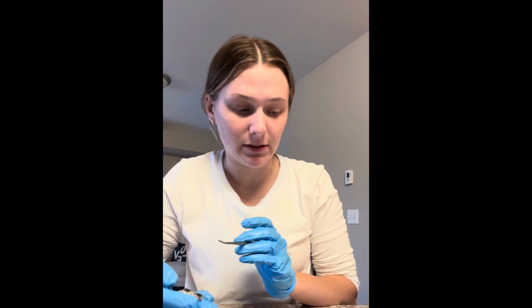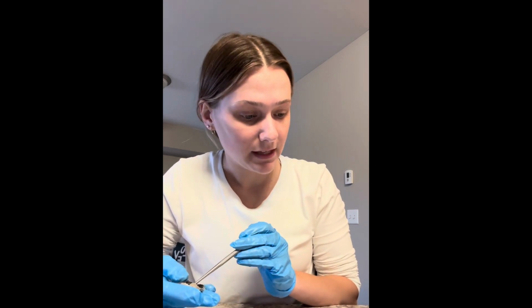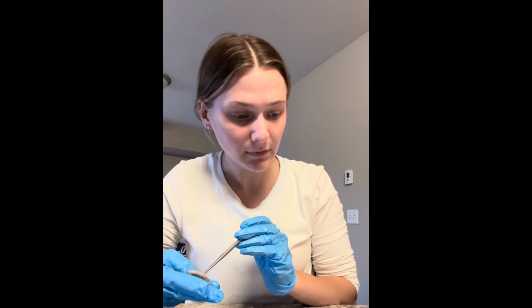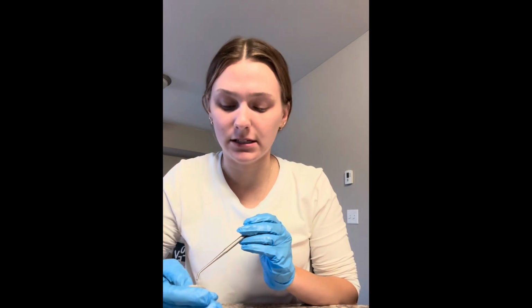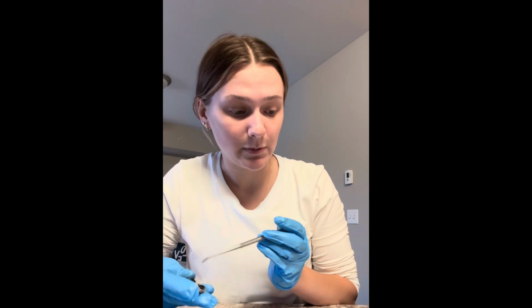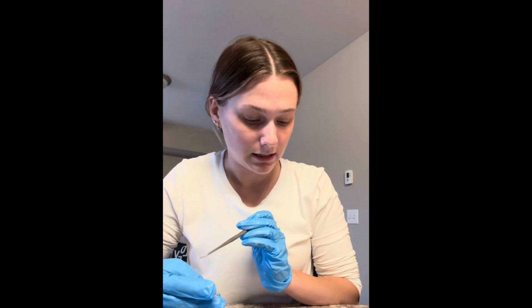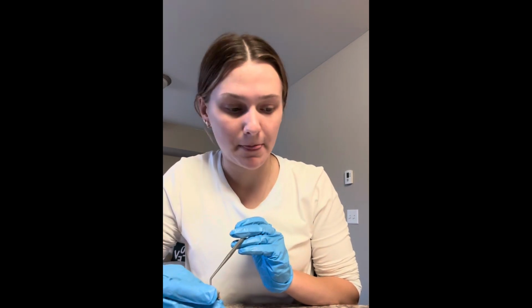First I'm going to talk about the iris. The iris is in between the pupil and the cornea on the lower end. So the iris is a diaphragm that regulates the size of the pupil. Next, I'm going to talk about the pupil itself. So as you can see the pupil really well. The pupil is an opening through which light enters the eye.